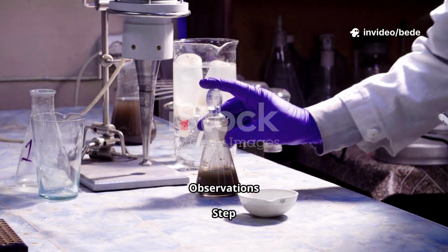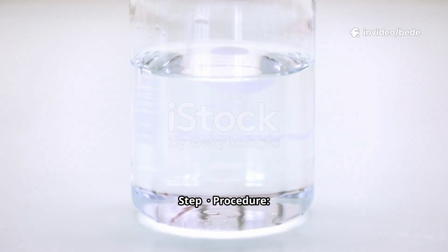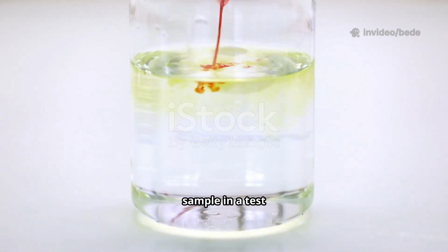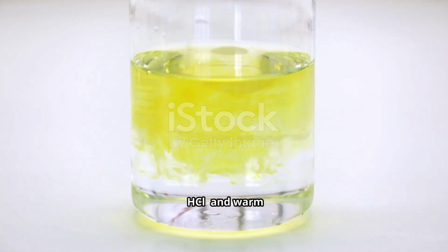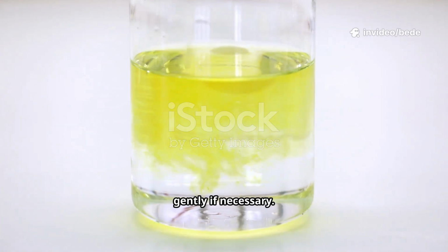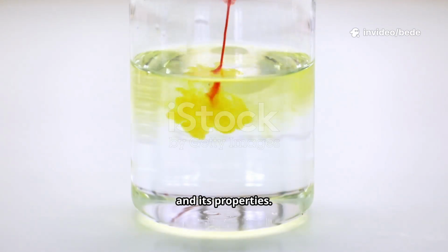Step-by-step procedure and observations. Step 1. The acid test, the most important step. Procedure: place the solid sample in a test tube or use the solution. Add dilute hydrochloric acid, HCl, and warm gently if necessary. Observe carefully if a gas is produced and its properties.